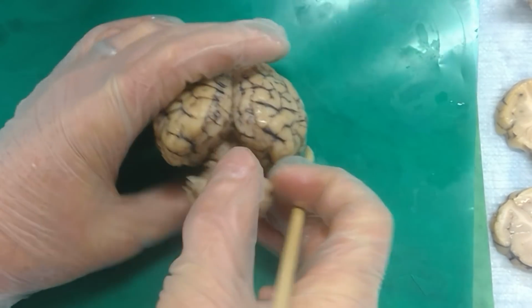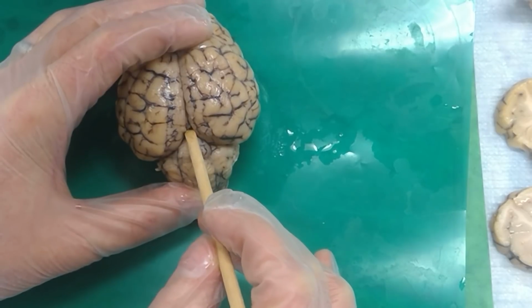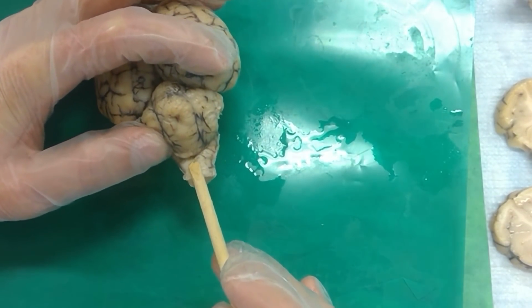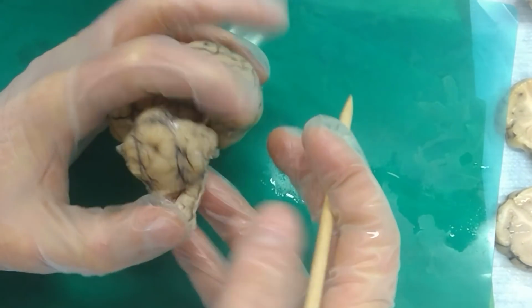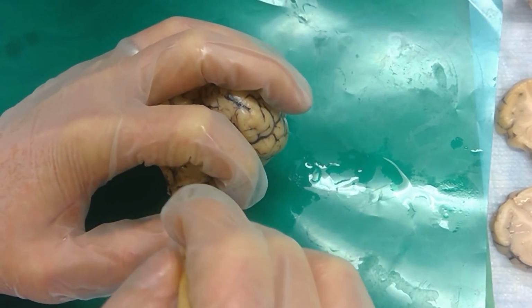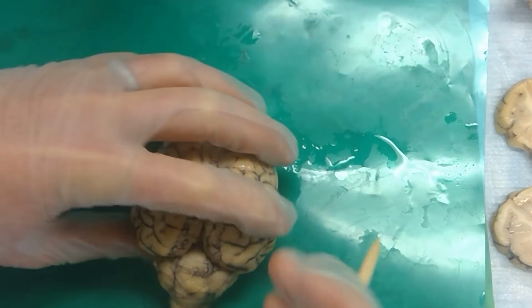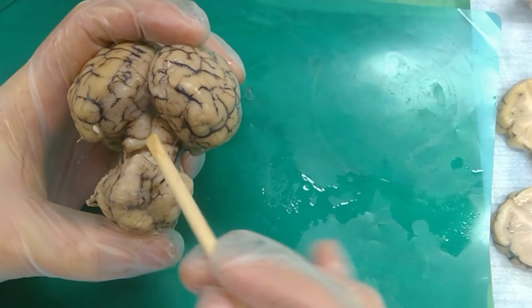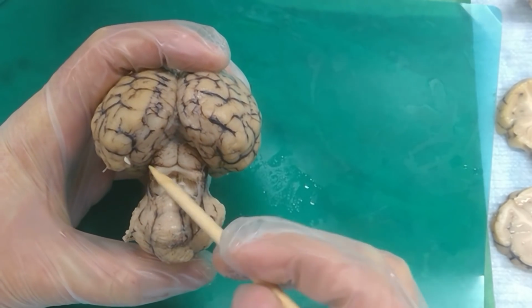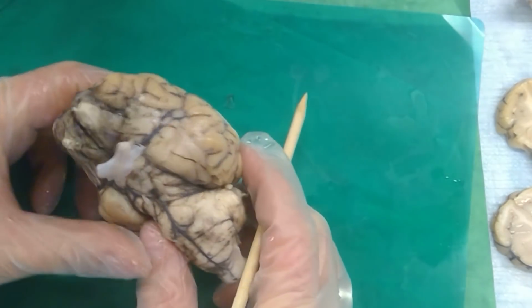Right. And this space outside the brain right here. And the space outside the brain right here. Cisterna magna. And then the tip of this V shape right here. Obex. Right, that's the obex there. And if we were going inside the brain, this space inside the brain in there. Fourth ventricle. Right. And then here, these top guys. Superior colliculus. And these bottom guys. Inferior colliculus. Correct.